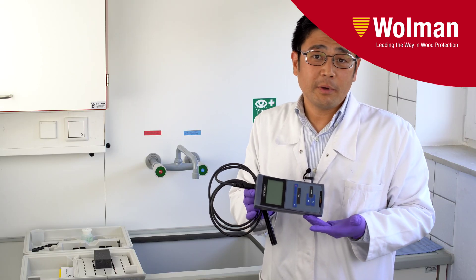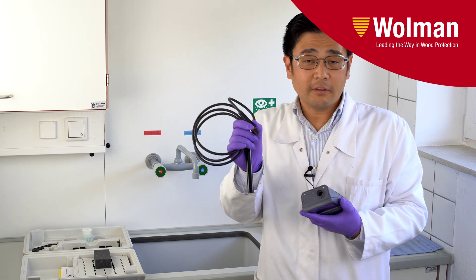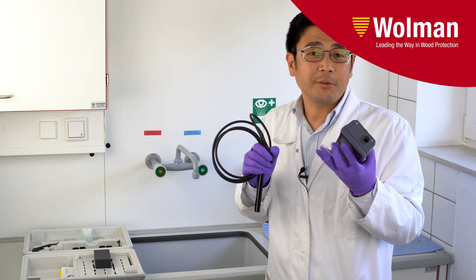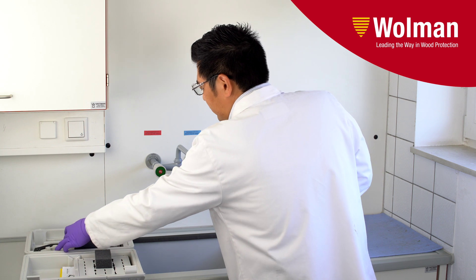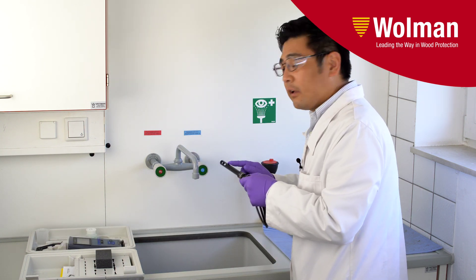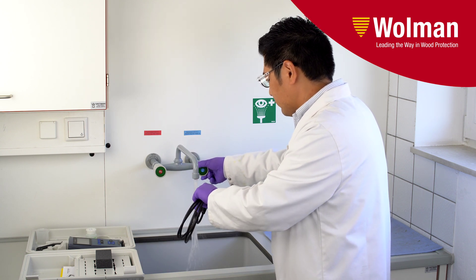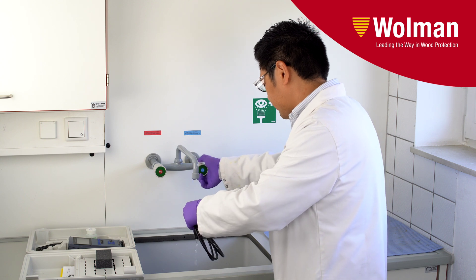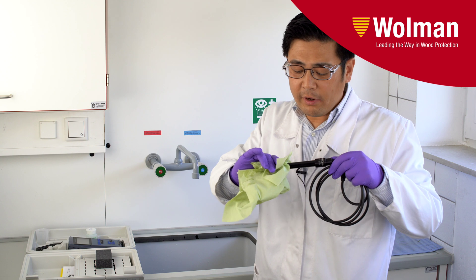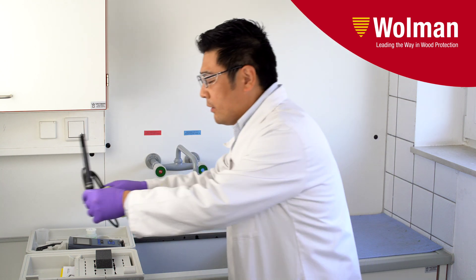Once you're done with the conductivity measurement, please turn off the device. Disconnect the measuring cell from the conductivity meter. Put the conductivity meter back into the case. Next, rinse the measuring cell under running water, and dry the measuring cell with a dry towel before putting it back in the box.